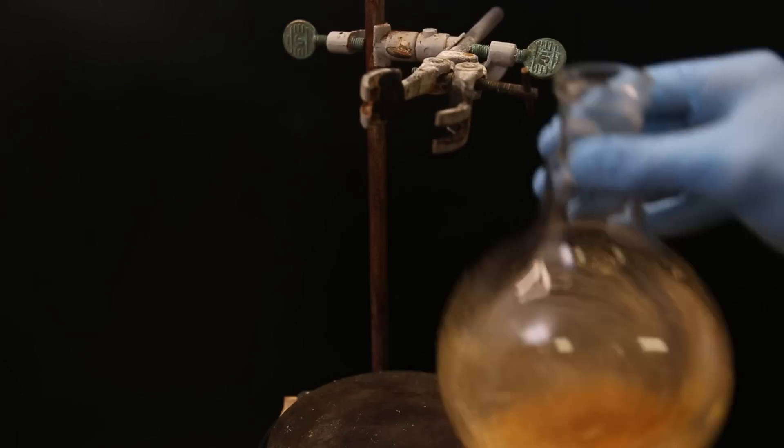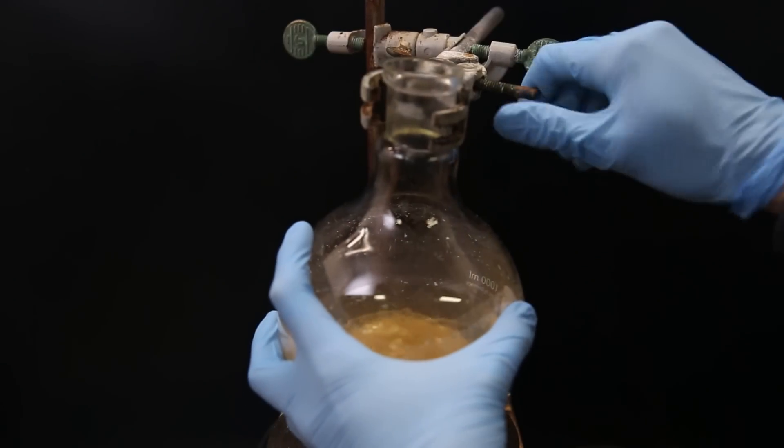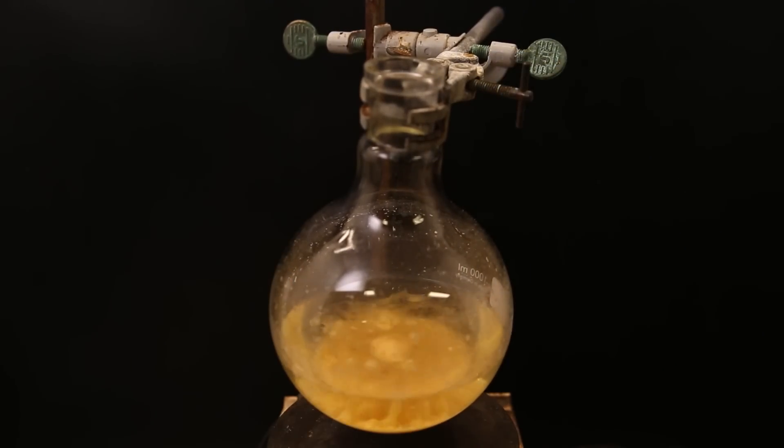So I assumed it was just tame. I shook the flask to mix it better because it looked like a bunch of solid, but it was more of a biphasic system, which is not ideal, so the water wasn't really quenching anything yet until I placed it back and just let the stirring do the job and the reaction slowly started.